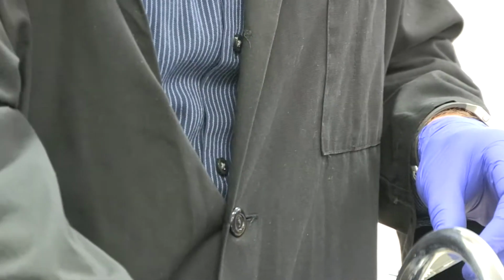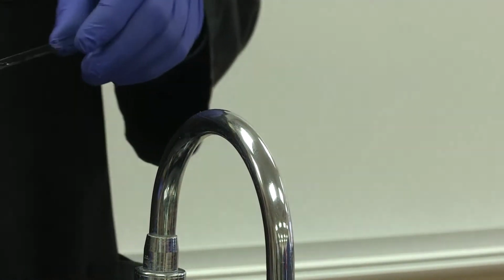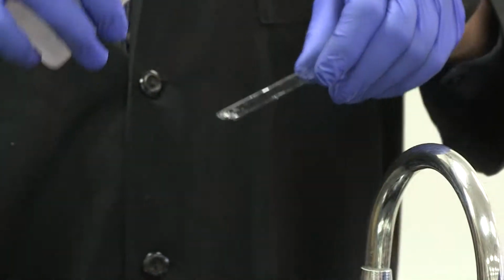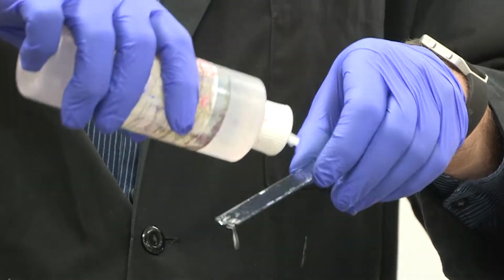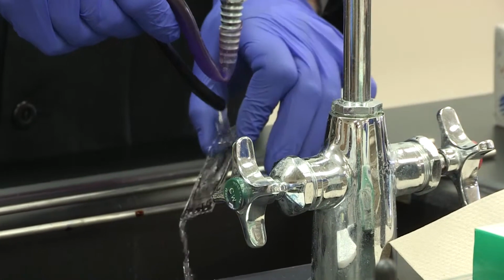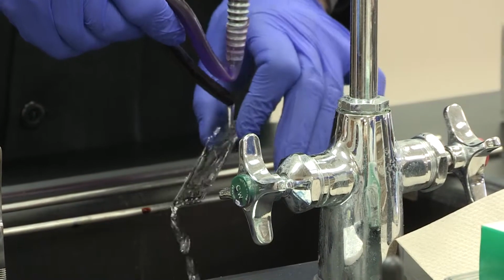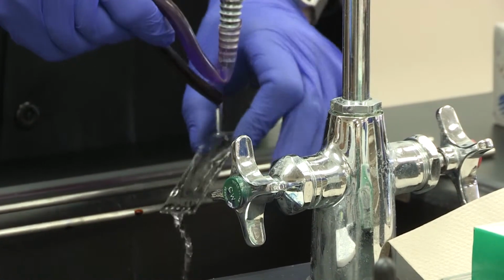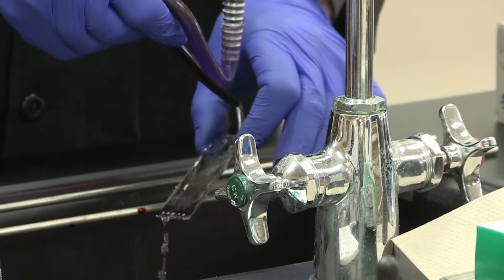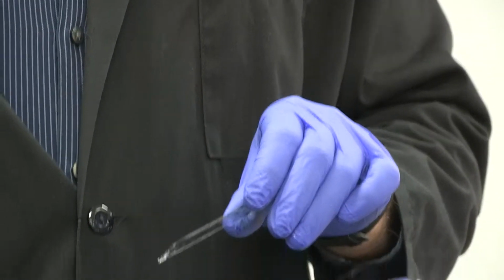So I'm going to go ahead and get my water going again, ever so lightly. Now again, watch how quickly this goes. I'm going to start 1, 2, 3, 4, 5. Okay? And so that's the good amount of time that you want to do this. Again, you don't want to typically go over 5 seconds because that's going to get rid of some of the gram-positive characteristic.